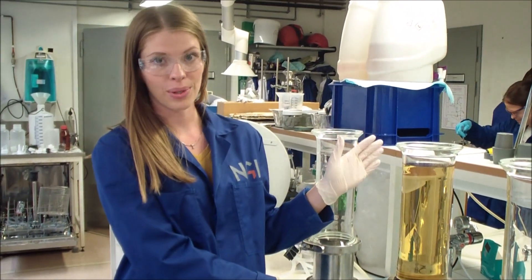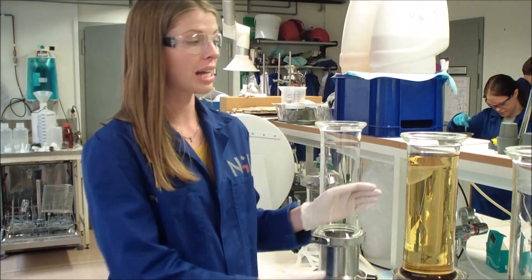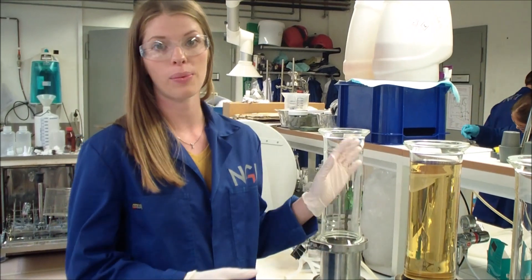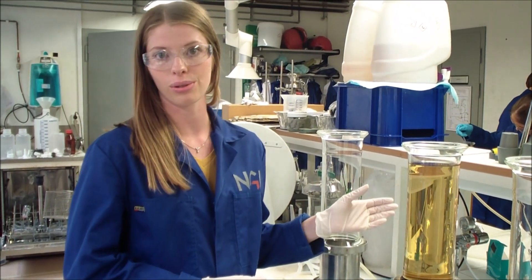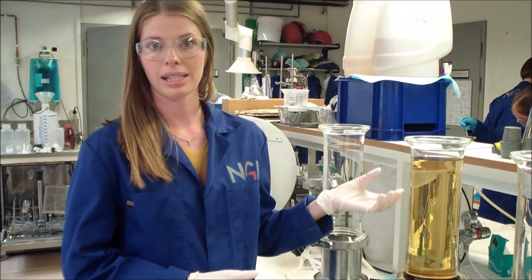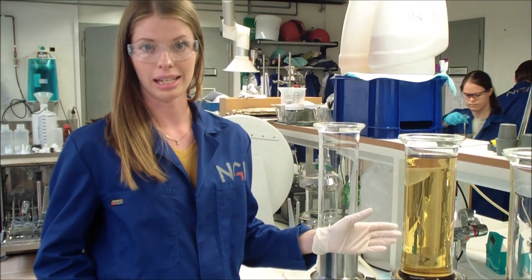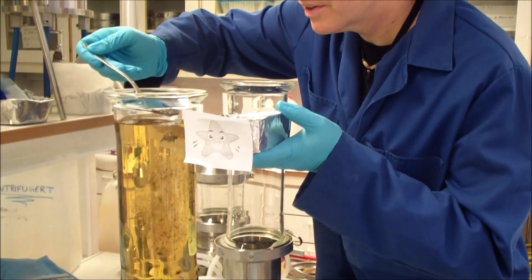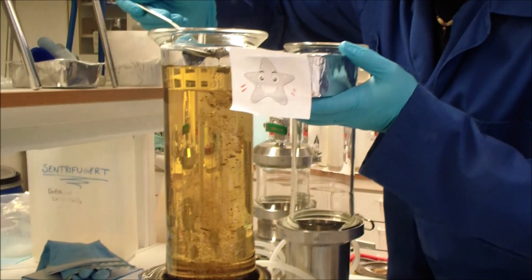Okay, so this is one of our density separators. Actually, it is a glass column that we have filled with a high-density salt solution, and this makes plastics float while the sediment sinks. So, we can break up the sediment as it goes down.